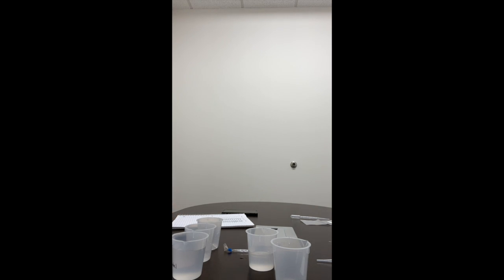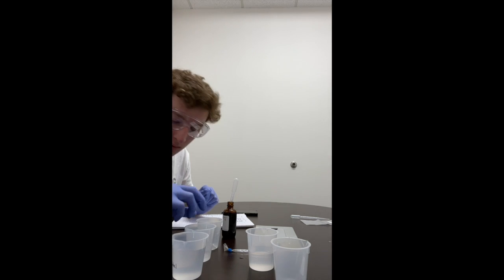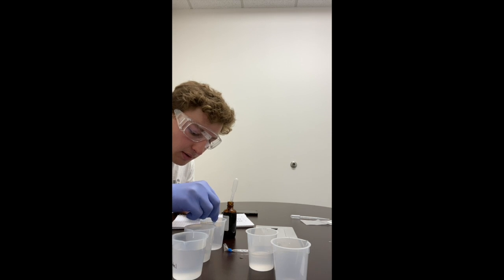And we'll wait for a minute to pass and see what color that gives us. It's been about a minute. We got a yellow color.